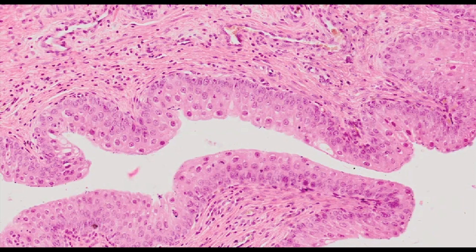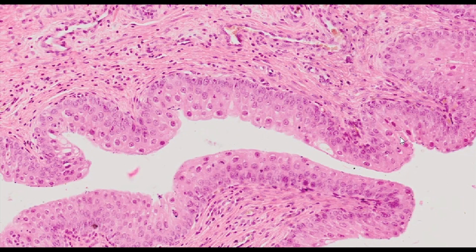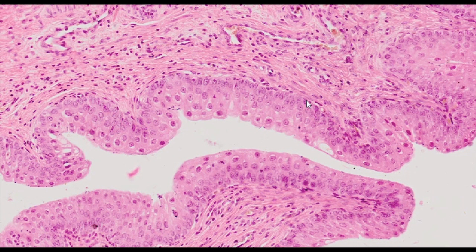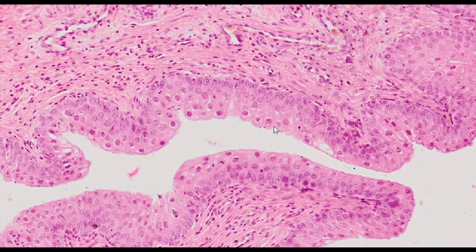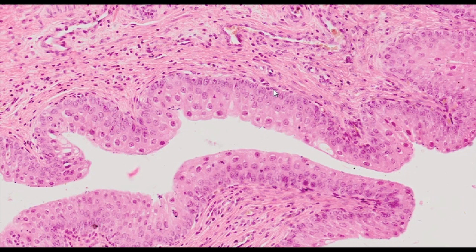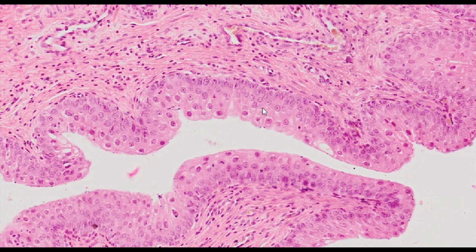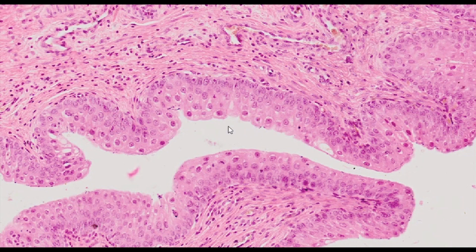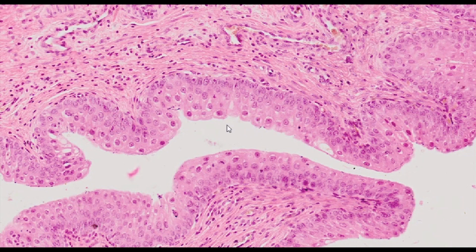Transitional epithelium, H&E staining. The transitional epithelium found in the urinary tract, the bladder and ureta, is also known as the urothelium.